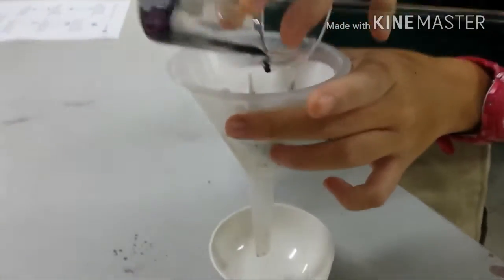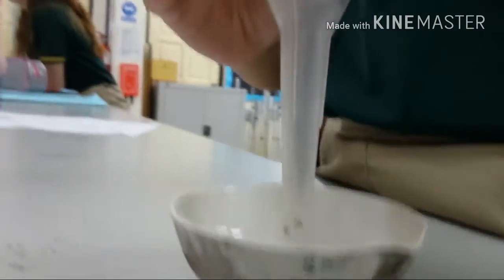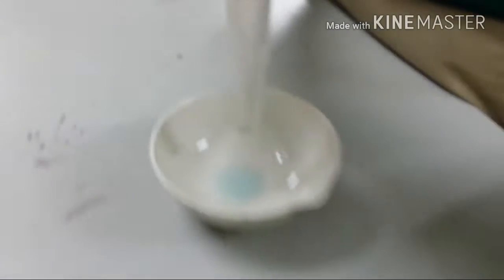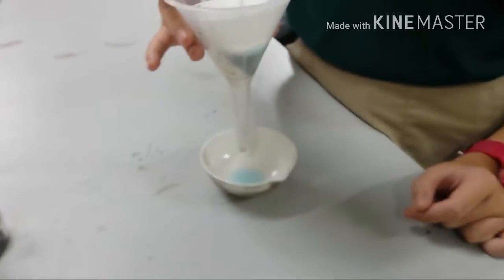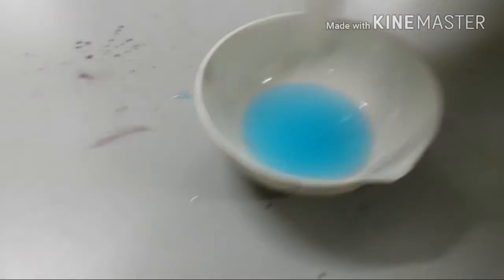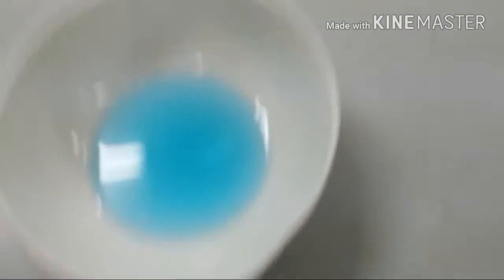It's pretty slushy. It looks like black ink. It's coming down — a very light blue color. Okay, so I've filtered it into a blueish color. That's pretty cool. We're gonna come back after once it's actually been filtered. After about four minutes of filtering, it's turned into this blue liquid from the blackish liquid.